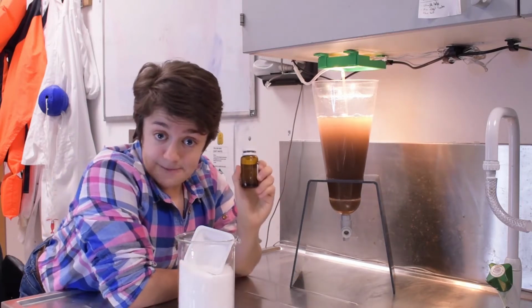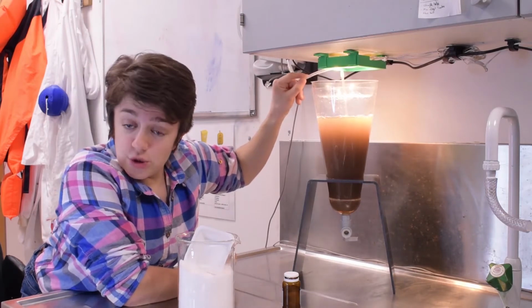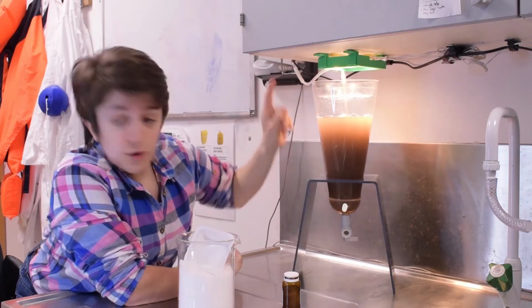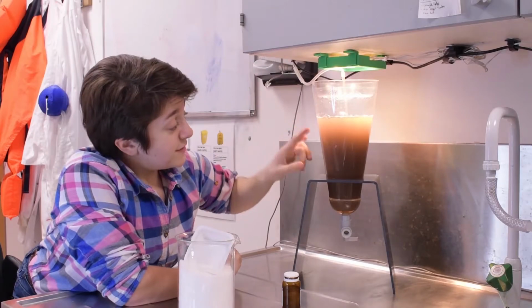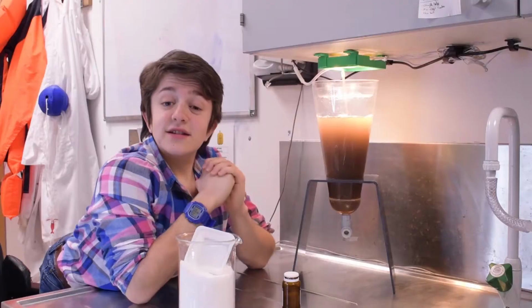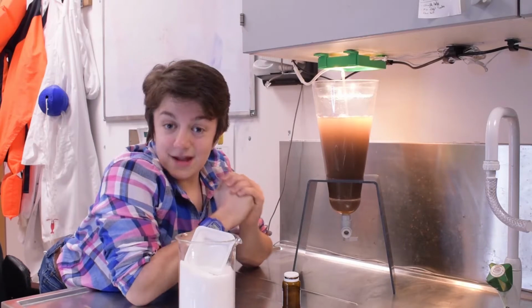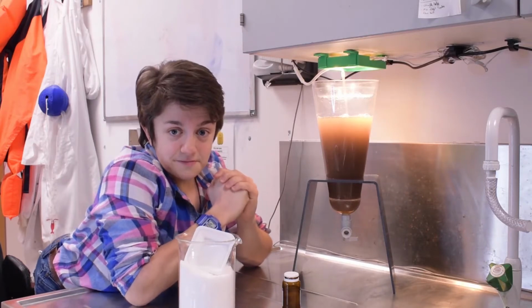Now, this is the system that we use to hatch brine shrimp here in our lab, and it's very simple. All it is a container in which we've put some water, a little bit of salt, and some brine shrimp eggs. Then what we do is we attach a piece of tubing to an air pump, and then we make sure that we have air flowing through this tank. And this essentially ensures that the water is always moving and that we have enough oxygen in the water for the brine shrimp to hatch. The other thing that we have here in this system is an LED light, and that's because the brine shrimp eggs need light in order to hatch.